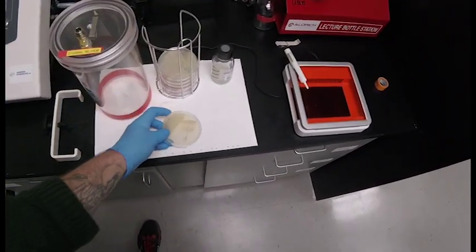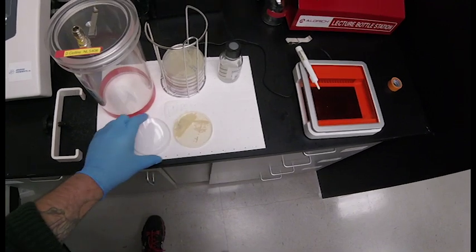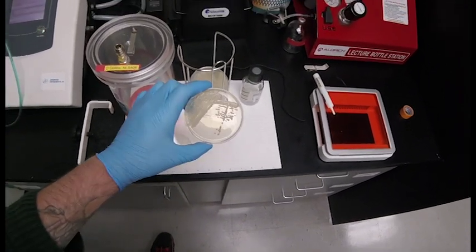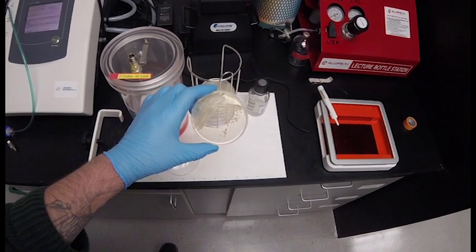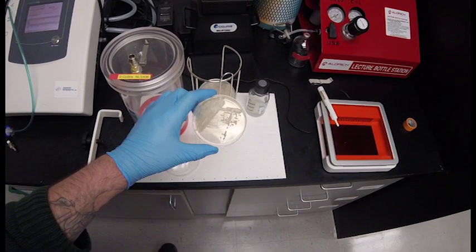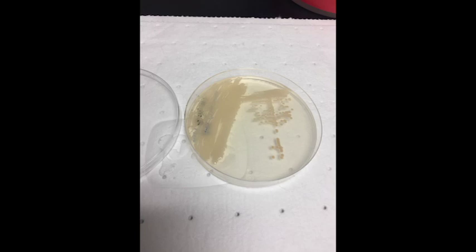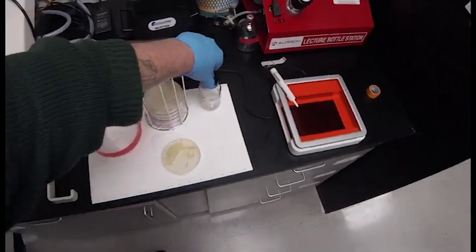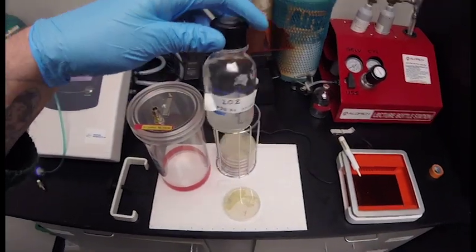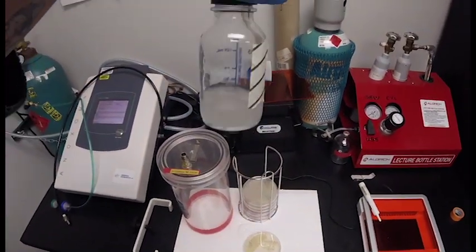After a few days you can evaluate the growth of the methanotrophs. You should see individual colonies on your agar plate. This species has a light pink color. Your liquid culture should appear cloudy or turbid when viewed. This is indicative of bacterial growth.